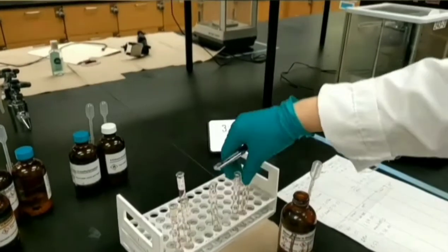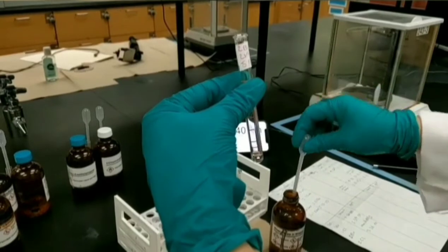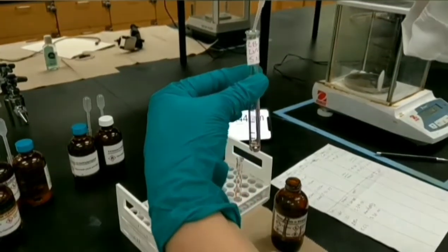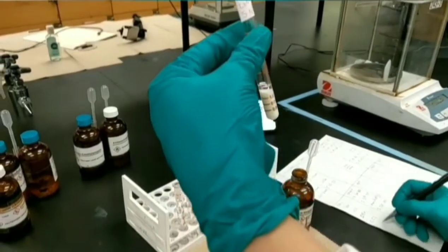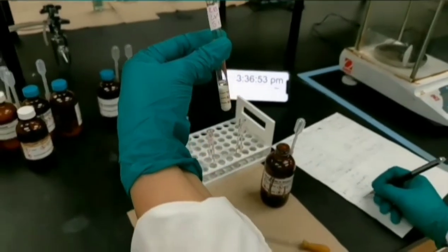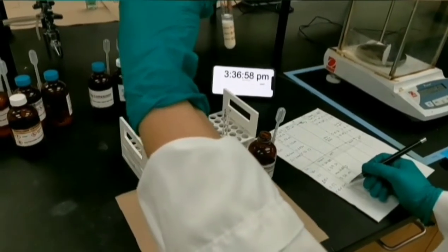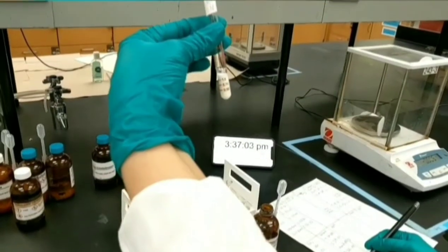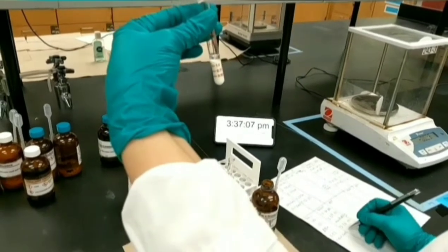I'm adding 1 ml of nucleophile to 2-bromo-2-methyl propane. It's a tertiary alkyl halide, and as we expected, it could produce immediately a very nice precipitation. It also has bromine as a good leaving group. For this reaction, just write that the substrate reacted immediately and you don't need to record any time.